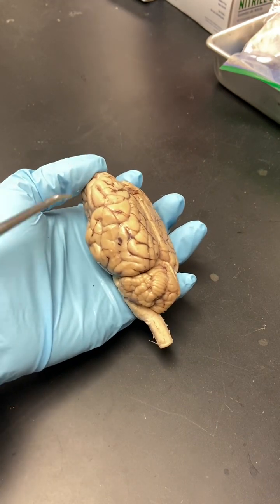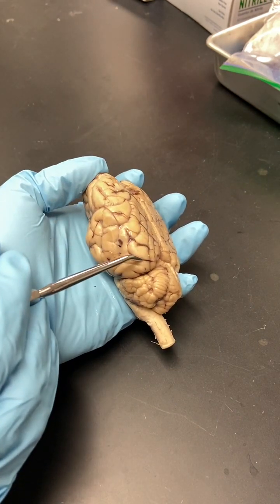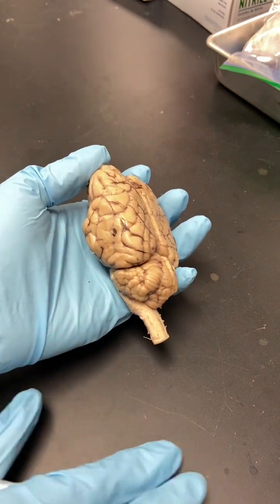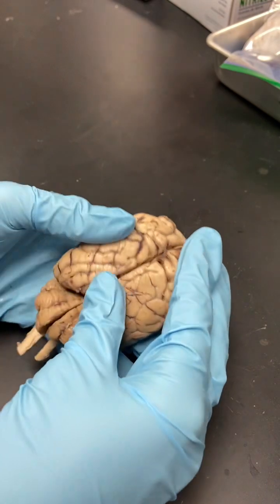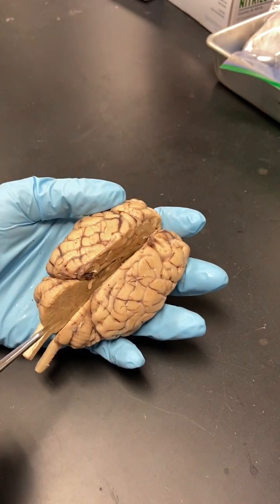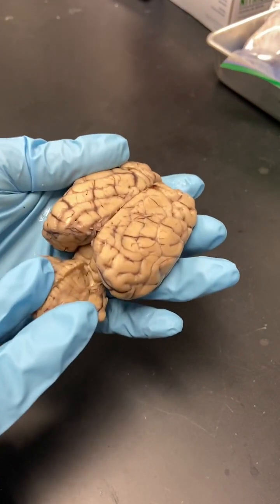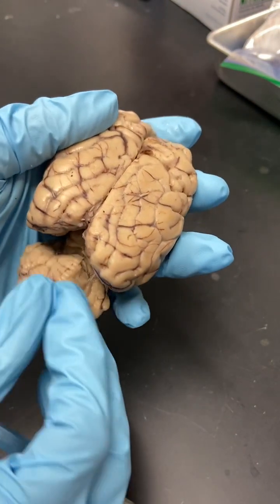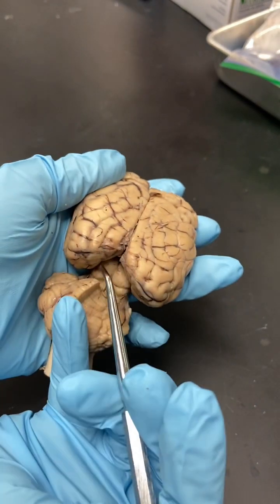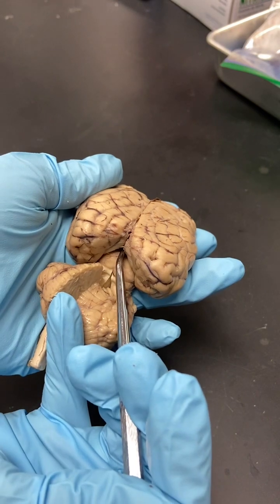The three main parts are visible here really well. You have the cerebrum, which is divided into 4 lobes. You have the cerebellum, and then you have the brain stem. So when you open it up along the longitudinal fissure, this is the longitudinal fissure, this is the transverse fissure. If you look in there, you can actually see the superior and inferior colliculi. These would be the superior colliculi, these would be the inferior colliculi, and then in there would be the pineal gland.